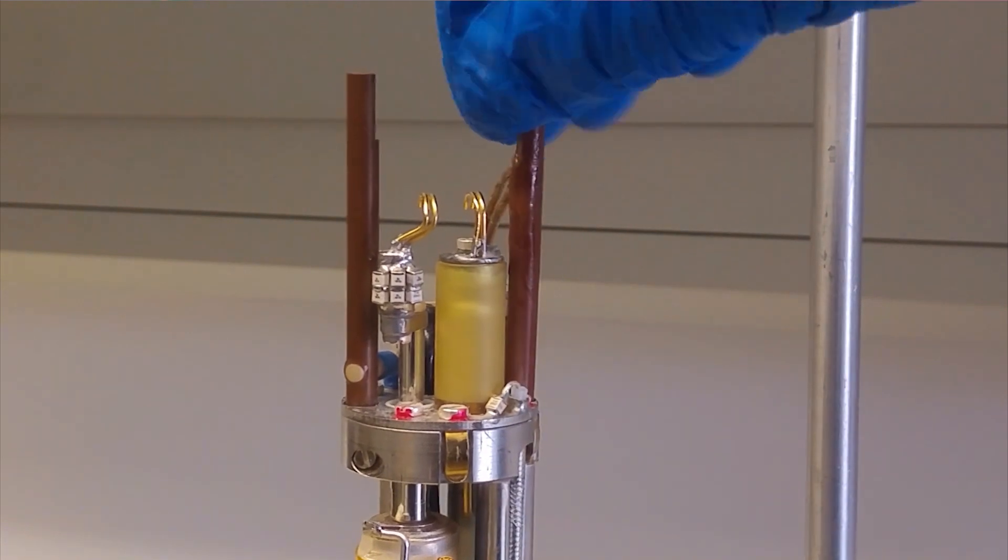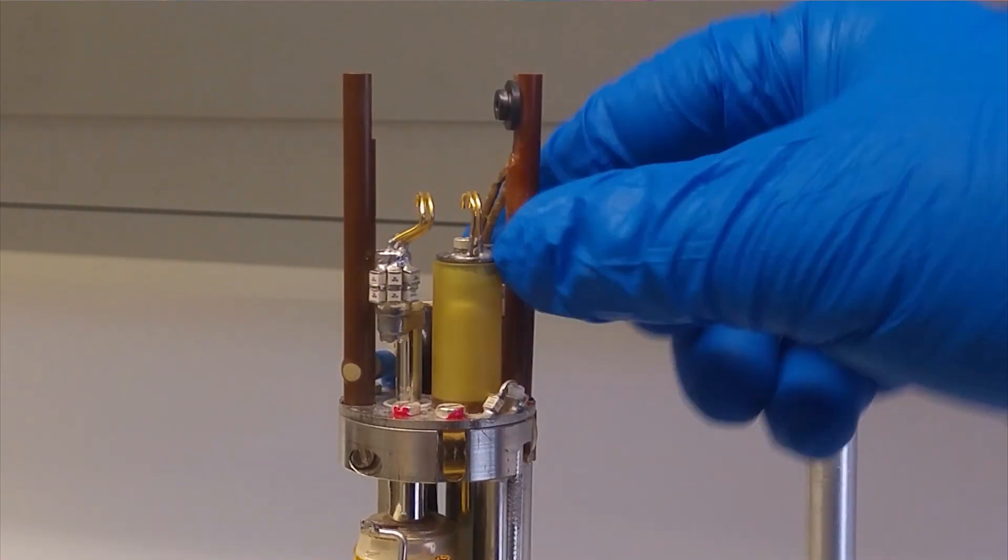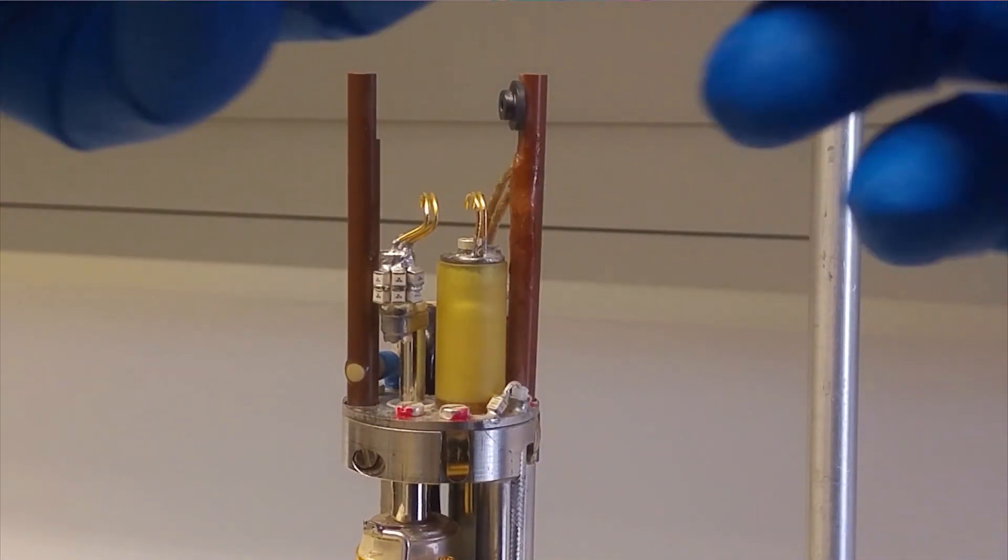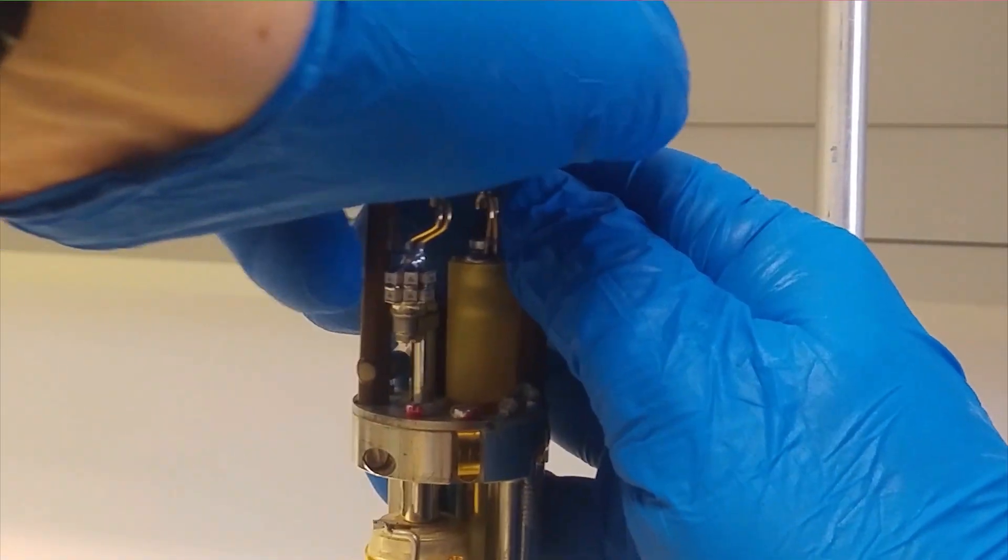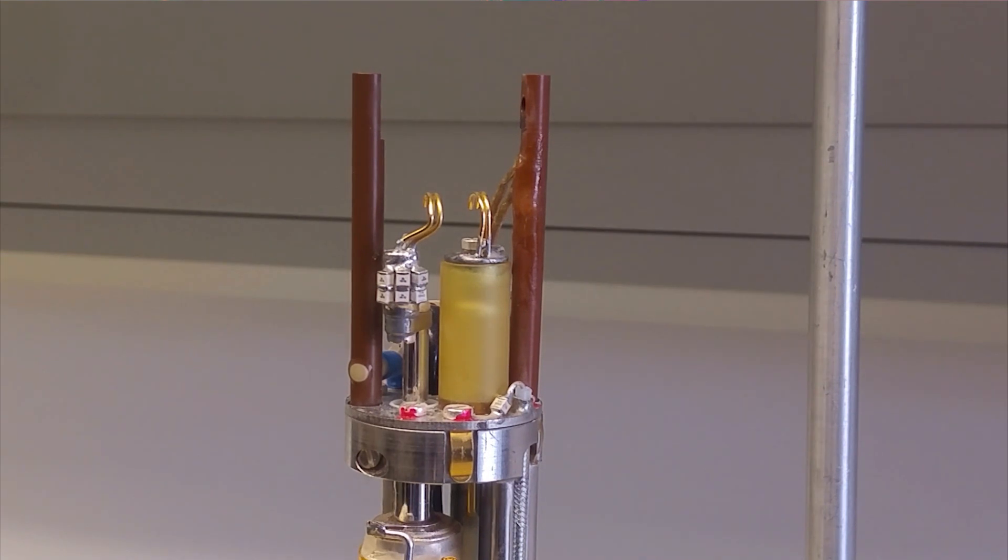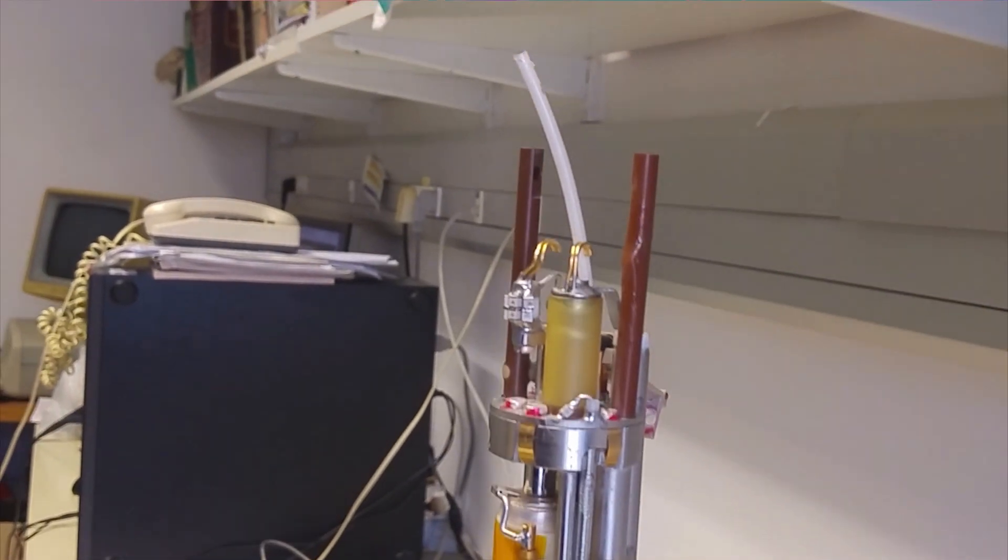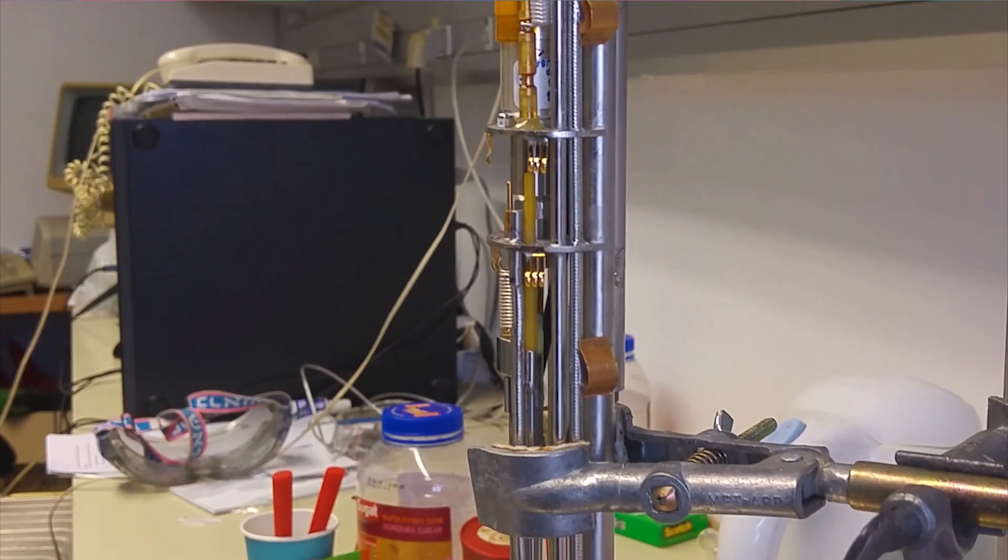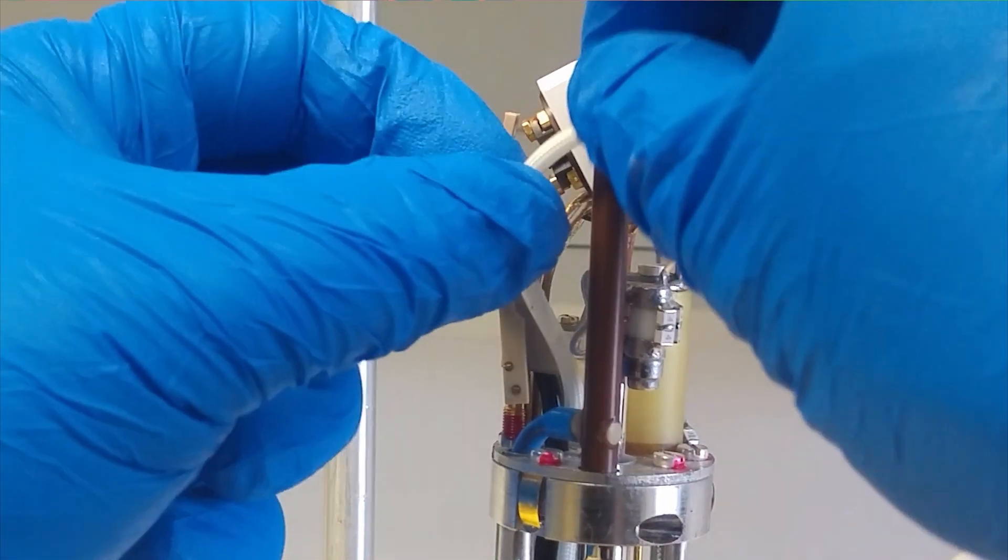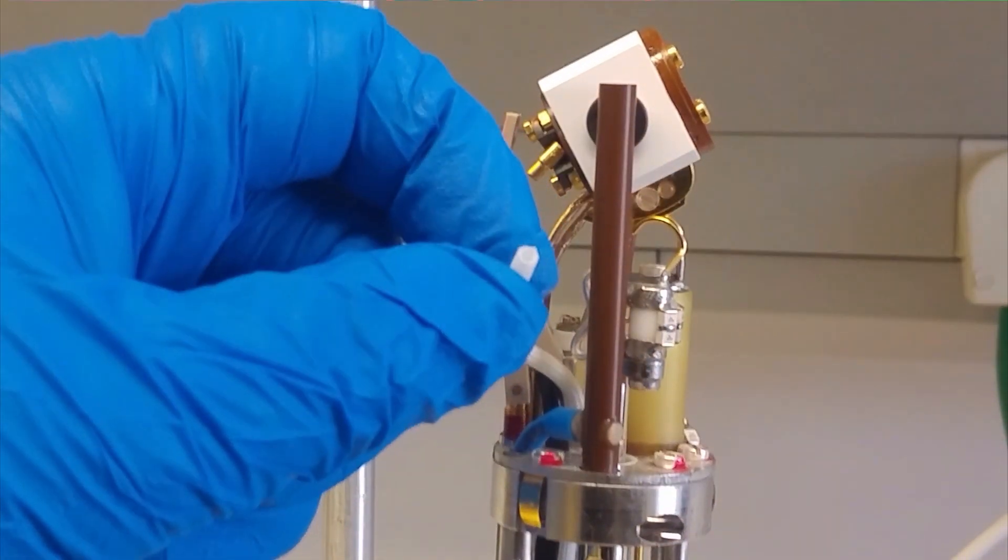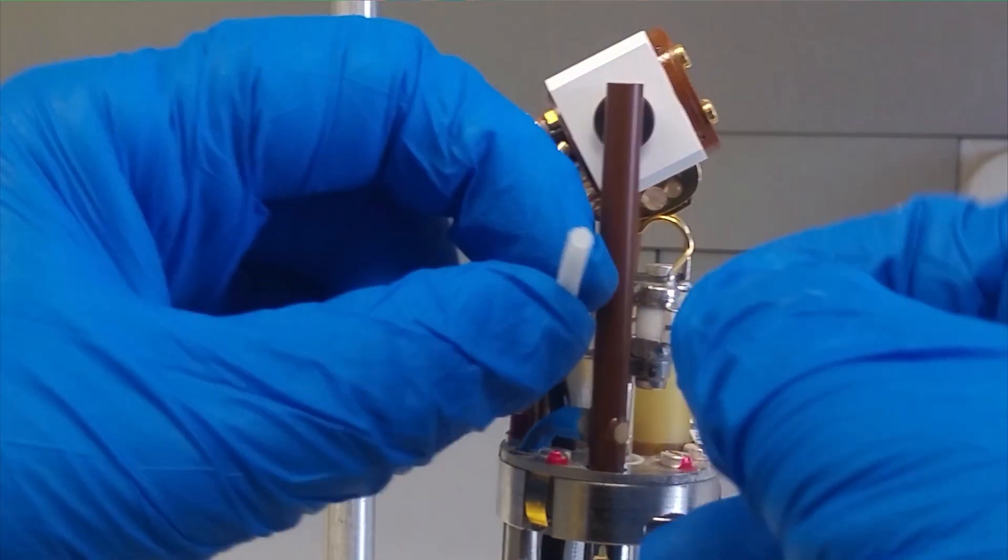Well, I didn't realize earlier that we were meant to take these out as well. So, we have to thread this into position. The hole here, here we go. In the end, I had to take the thing apart and thread it all the way through. I need to cut this to approximately the right length. In any case, it won't fit on anyway, so let's cut. And then, try and put this piece back on.